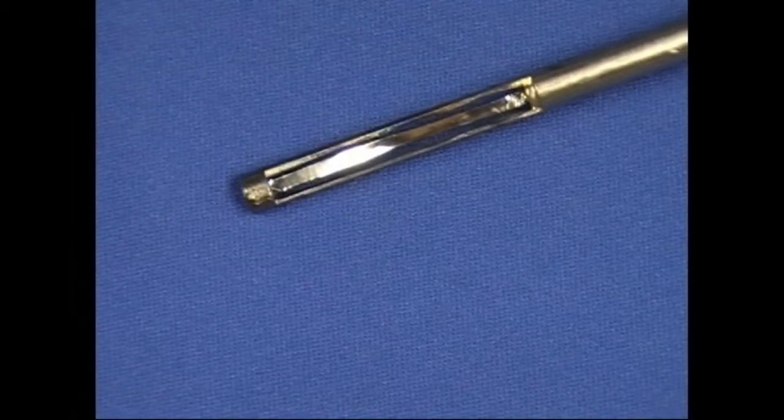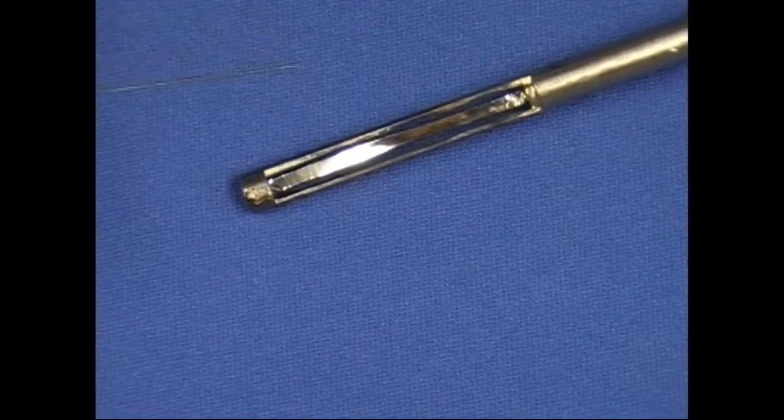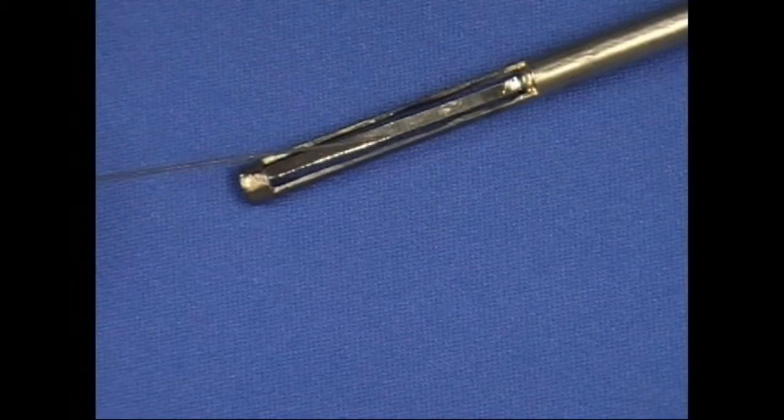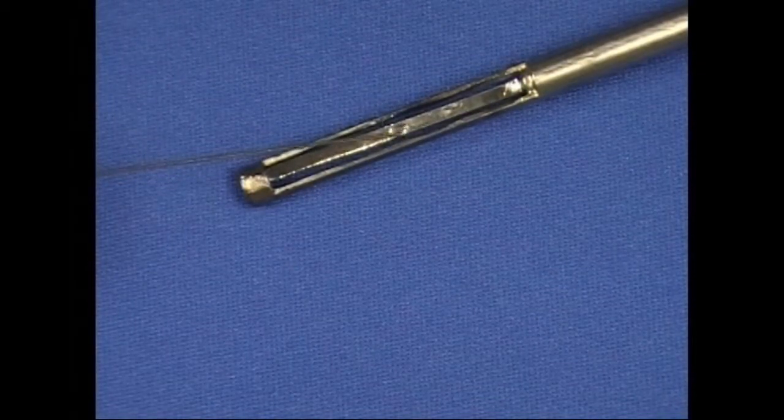The other way to use the ribbon filament is to take a solution and apply using a syringe. You apply the solution directly onto the surface of the filament, right in the center.